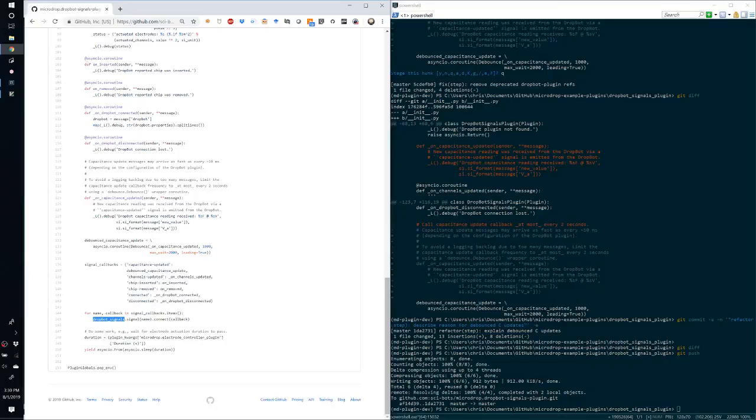So if we weren't doing anything else in this function, then we wouldn't actually see any of these logging messages, because the function would exit immediately and those signals would be disconnected. However, the more likely scenario is that you're going to be doing some kind of work.